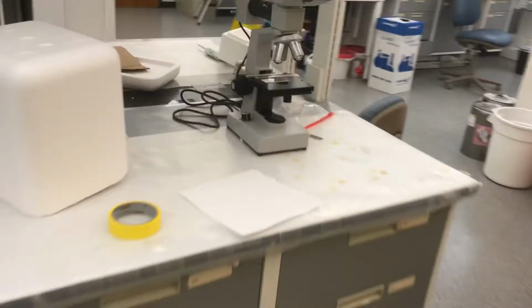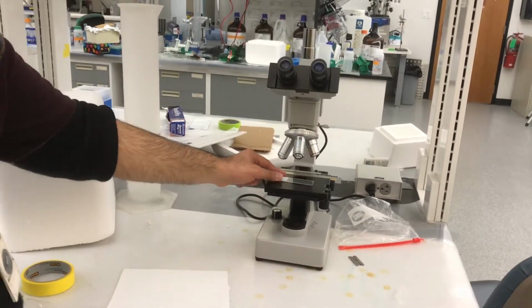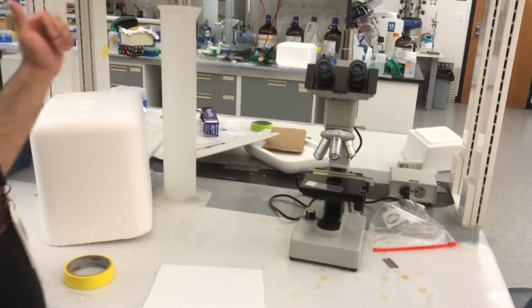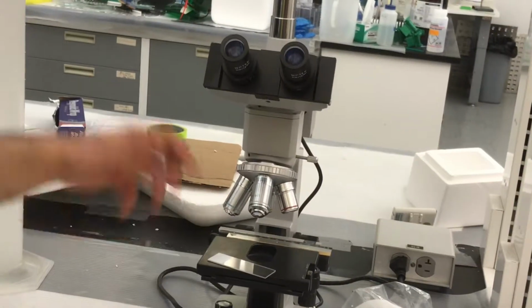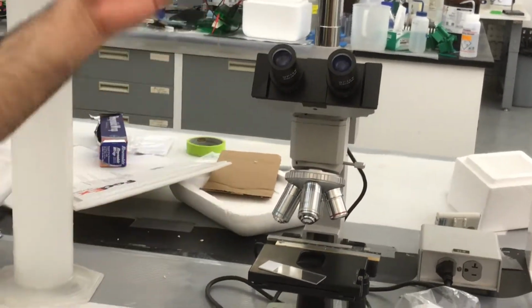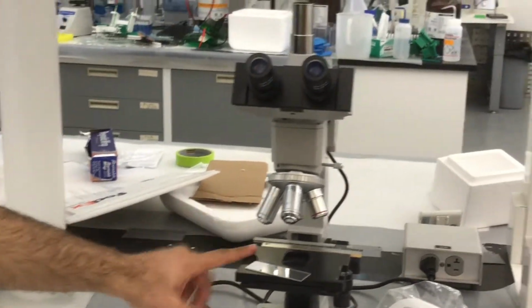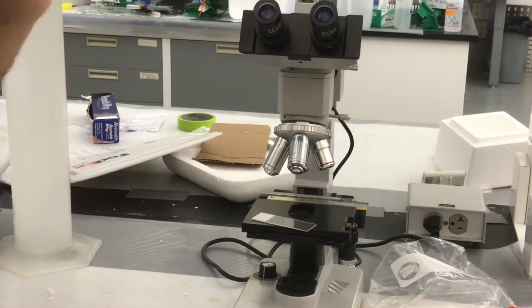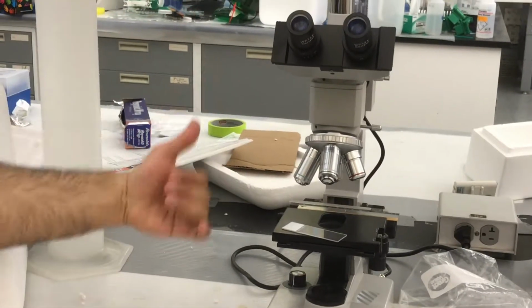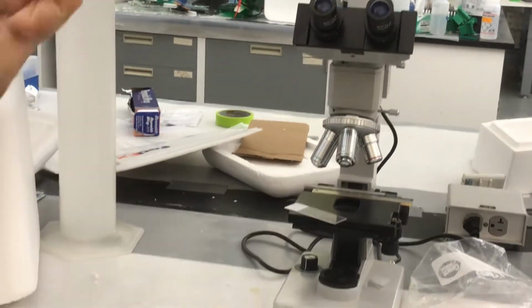This is a microscope. We use it for two purposes. One is when we punch the chip, to make sure all the punches are aligned and in the center of each channel. Tomorrow we will show that, because it is two days of work. The other is when we prepare the master mold, to see that all the silicon structure is accurate and sharp and everything is going well.